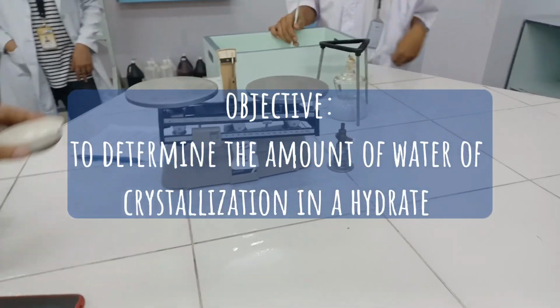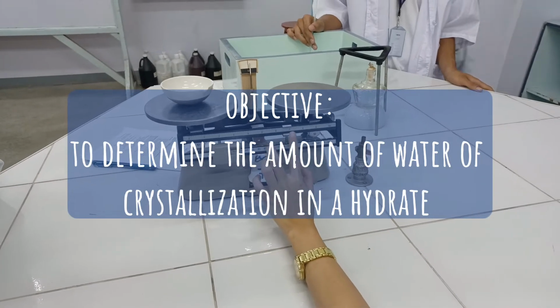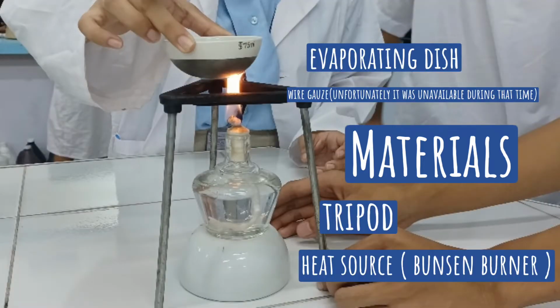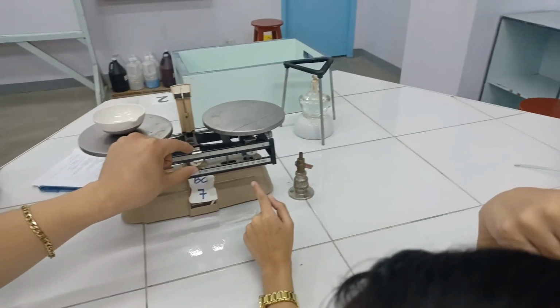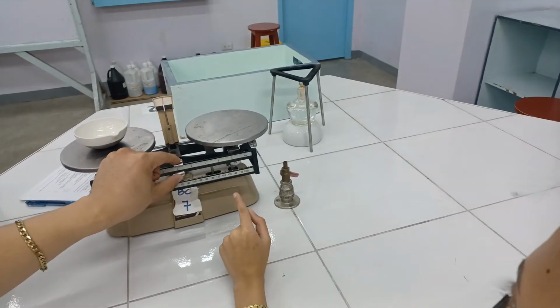The objective of this laboratory activity is to determine the amount of water of crystallization in a hydrate. Materials used during the laboratory activity. Procedures: weigh the clean, dry evaporating dish and record its weight.